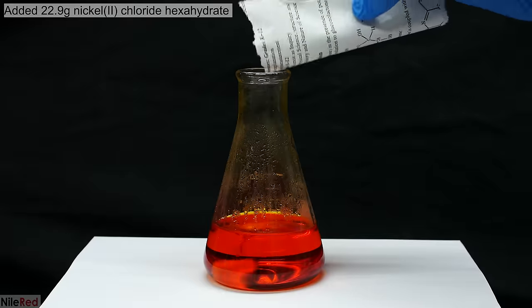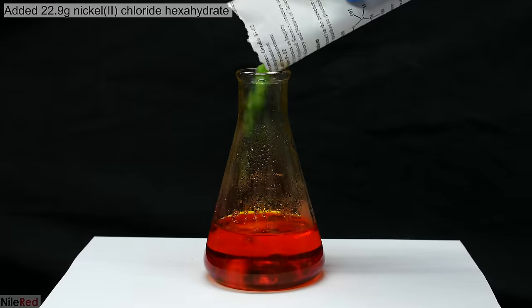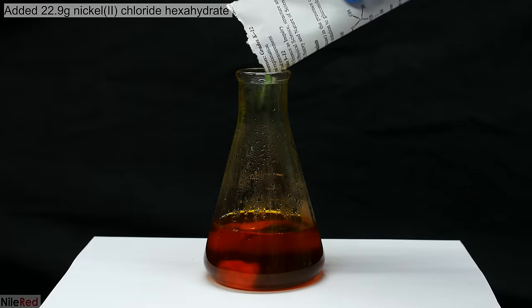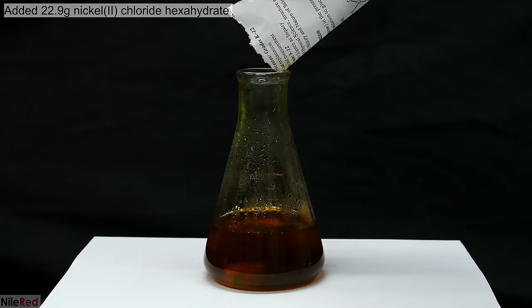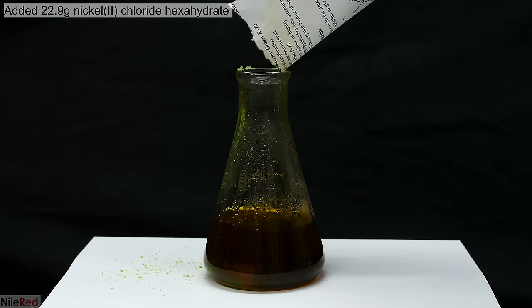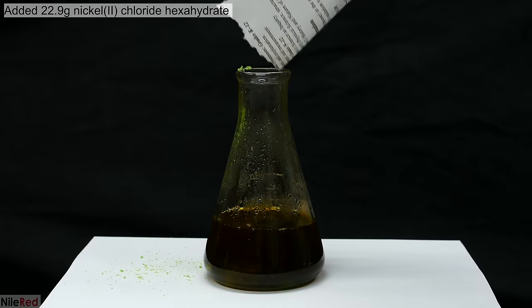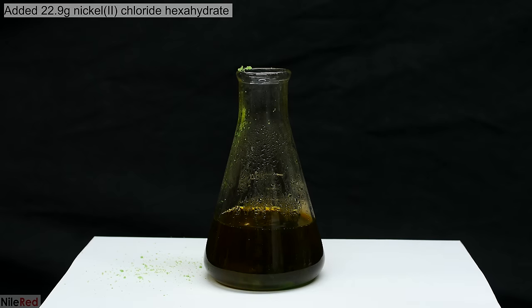After the 30 minutes, I dumped in 22.9 grams of nickel chloride hexahydrate. This is allowed to stir until everything dissolves. You'll notice here that it messed up a little bit, and some of the nickel chloride didn't make it into the flask, but that really shouldn't be a problem.